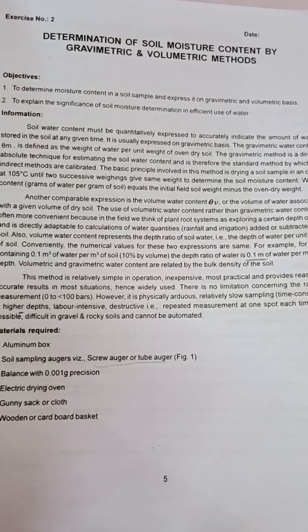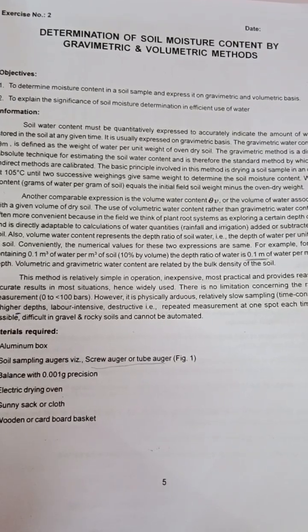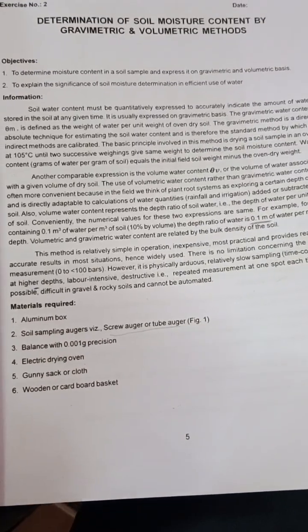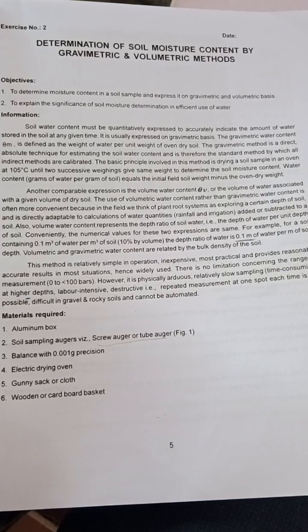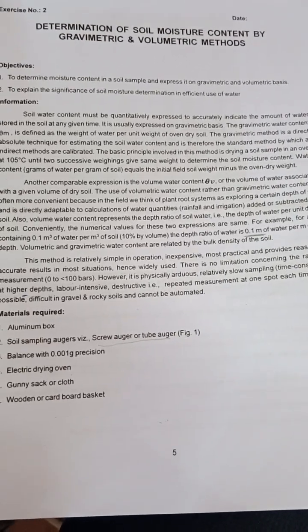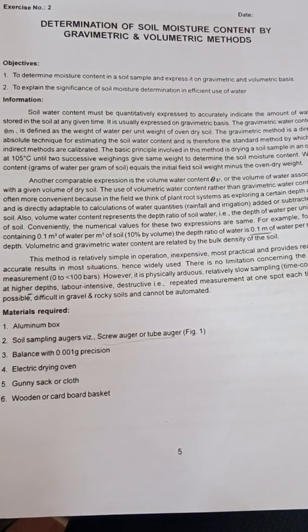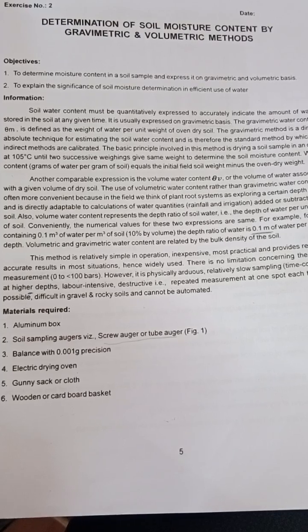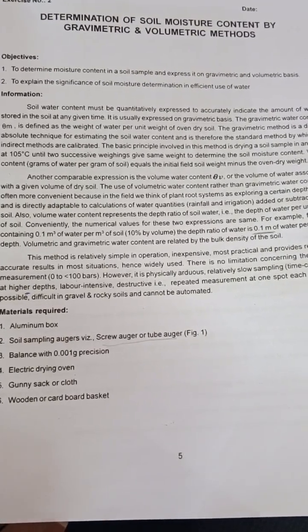Volumetric and gravimetric water content are related by the bulk density of the soil. This method is relatively simple in operation, inexpensive, most practical, and provides reasonably accurate results in most situations. Hence, the gravimetric and volumetric methods are widely used. There is no limitation concerning the measurement of volumetric and gravimetric water content from 0 to less than 100 bars.